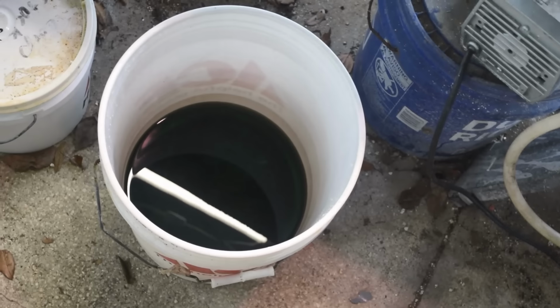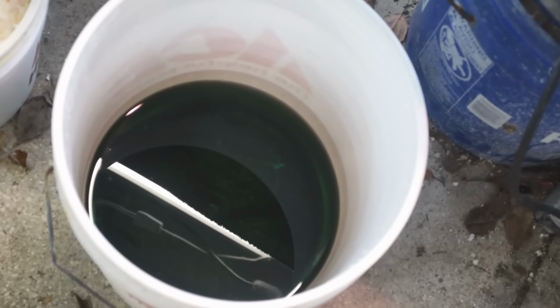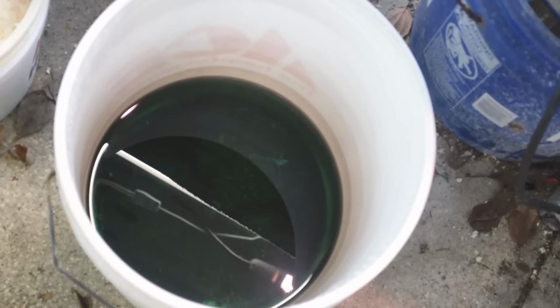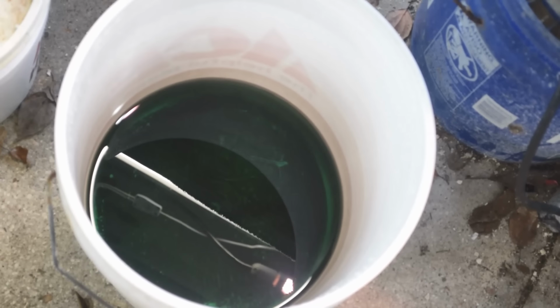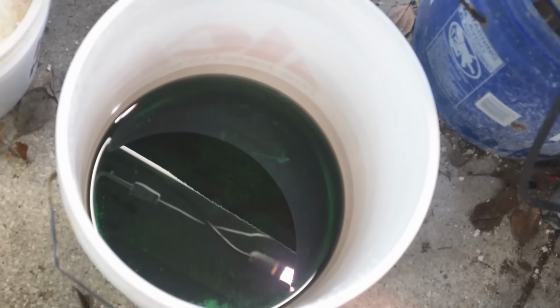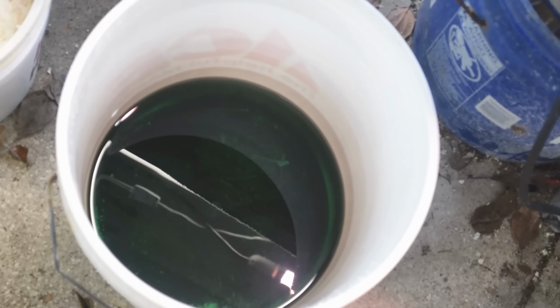Now, I don't know if it's going to show up or not. But there's already, and focus, there's already a pretty good layer of black stuff on the bottom of that bucket. And most of that black stuff is going to be gold. Not all of it, but a lot of it's going to be gold.